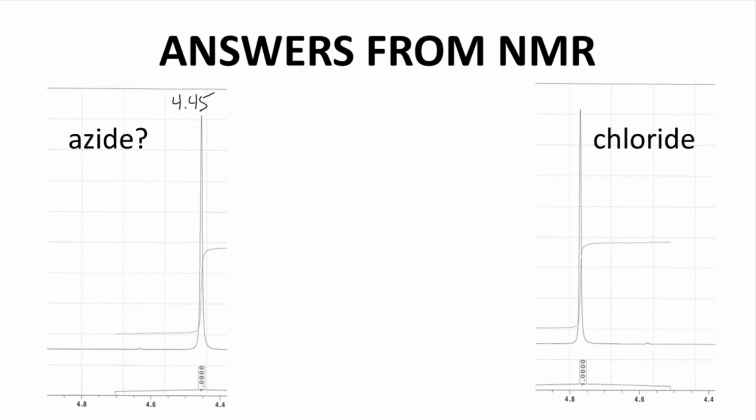The CH2 shift for benzyl chloride is approximately 4.77 ppm, a bit further downfield. I'll note that both of these spectra were obtained with the same NMR solvent, deuterated DMSO. To confidently compare NMR shifts, all the samples should be analyzed with the same solvent. What I obtained as a product does seem to have a different chemical shift and certainly seems very unlikely to be benzyl chloride. If it's not benzyl chloride, it's almost definitely benzyl azide.